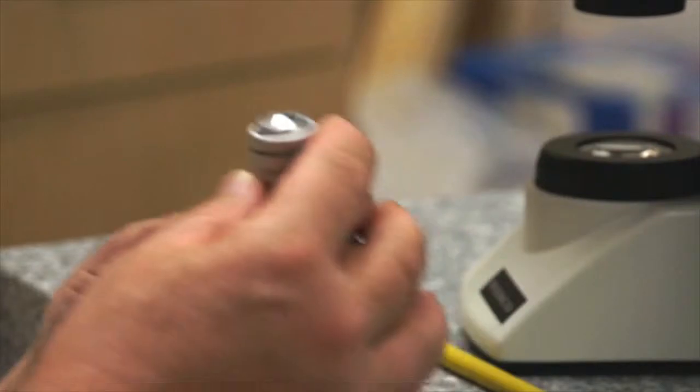Another feature that's important on the objectives that you'll be working with, particularly the 63x objective and the 100x objective, is that you can compress the front of the lens down and rotate it, and it locks down and out of the way. This is very useful if you're rotating the nose piece and you don't want your objective to make contact with your slide or something on the stage. So remember that you can lock them down and out of the way.